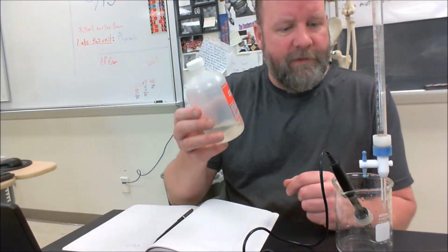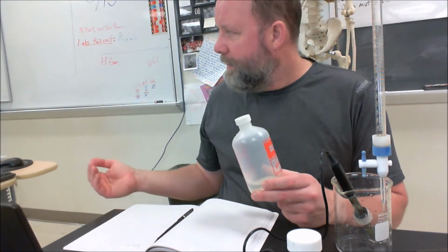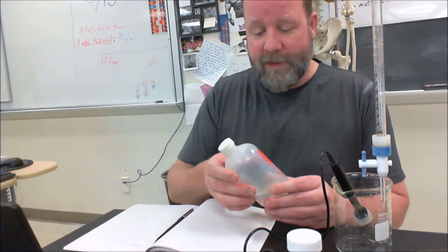To calibrate, I have standard solutions of pH 4 and pH 10. I'm going to put that in the computer and tell it this is pH 4 and then make a reading, and say this is pH 10 and then make a reading. And that gives it 2 data points so it can accurately measure the pH of any sample that I give it. So I'm going to type in 4.0 on my computer.